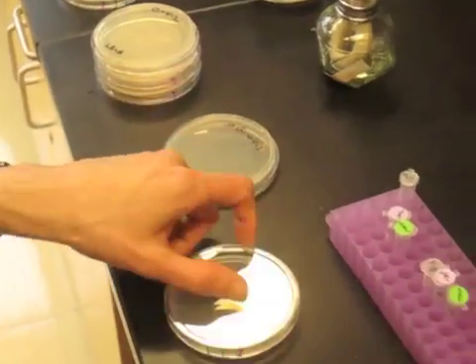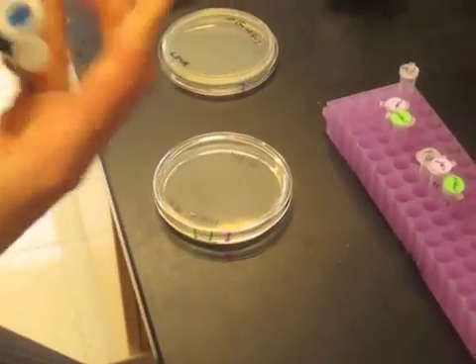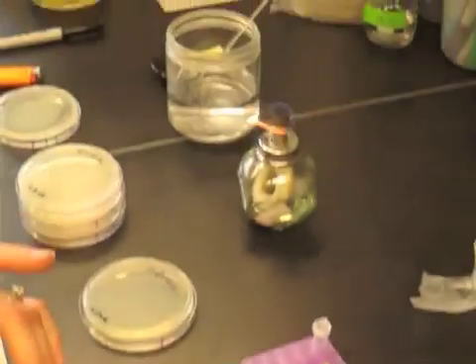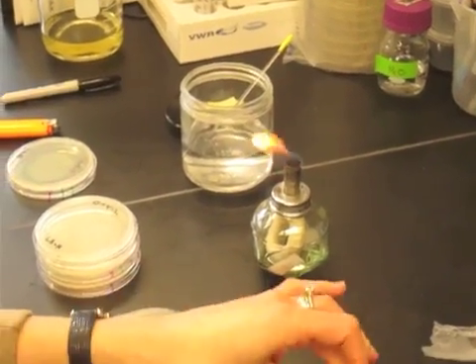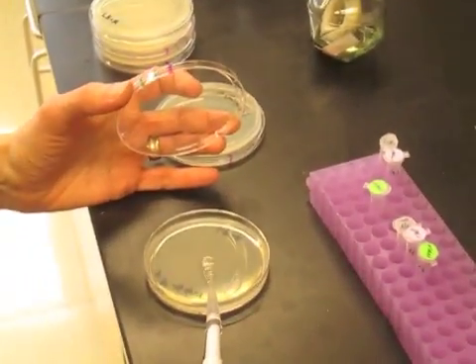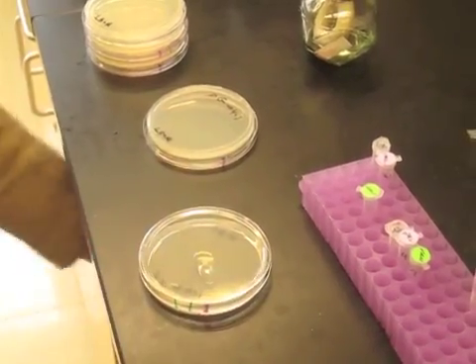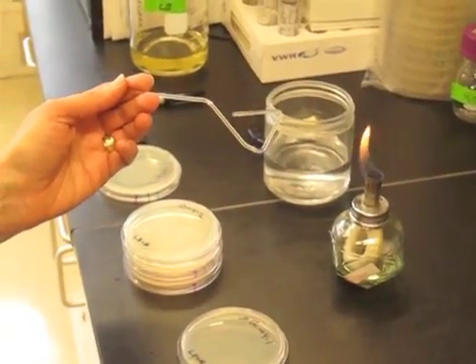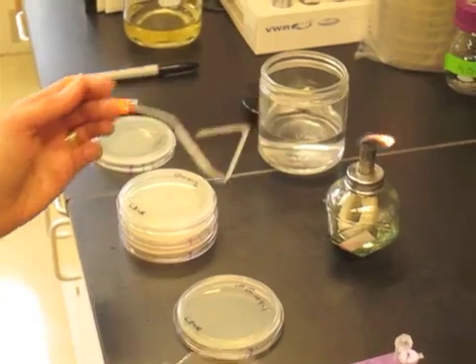The other way to do it would be to take the spreader which many students in many places have. So again you just put 250 microliters on the surface of the plate, and if you have a glass spreader or a plastic spreader that you can sterilize by passing through the flame.